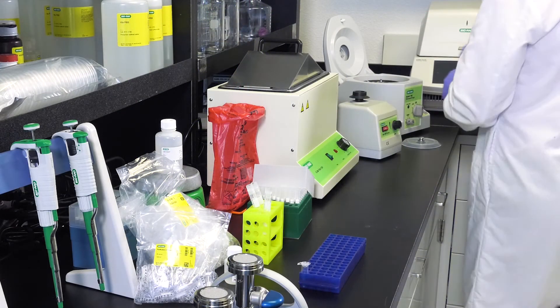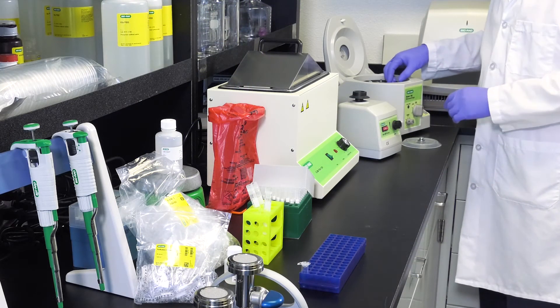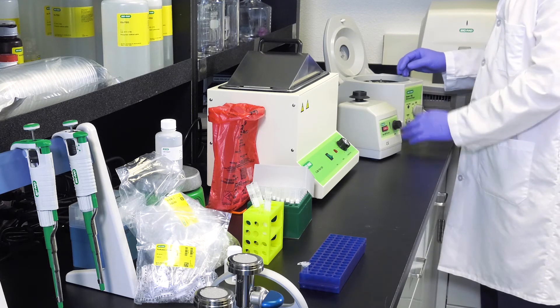Centrifuge the purification column for 10 minutes at 6,000 times G. After centrifugation, empty the collector vial.